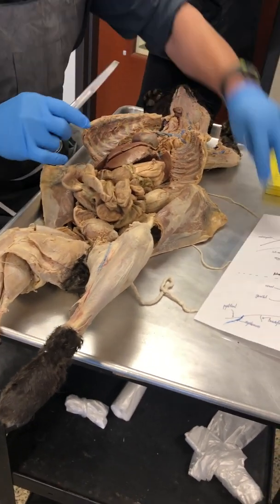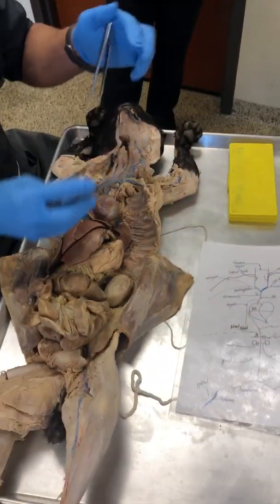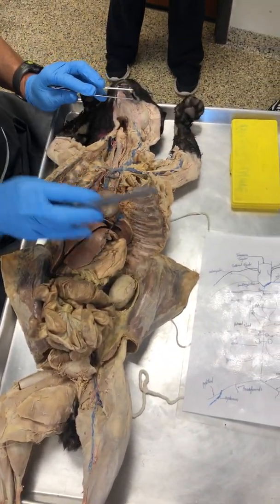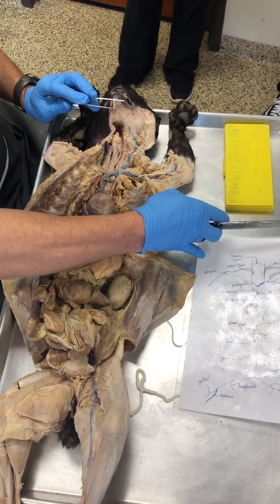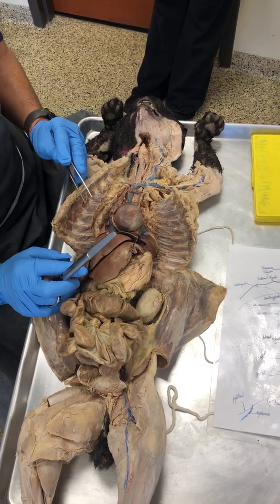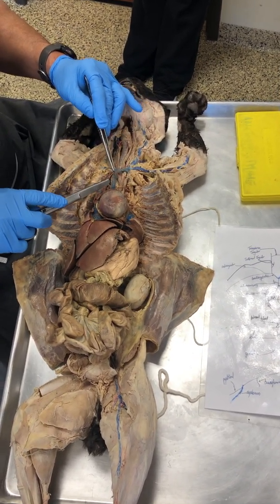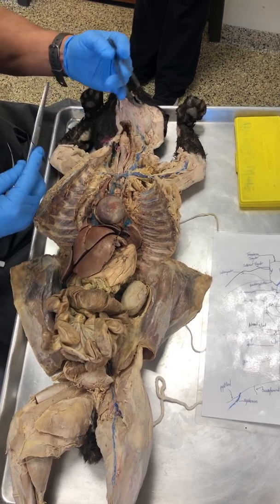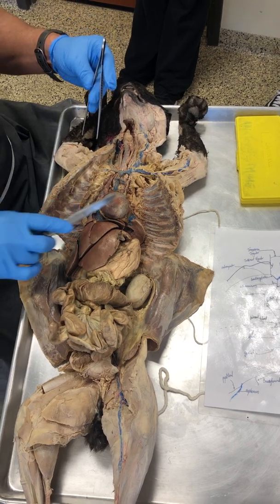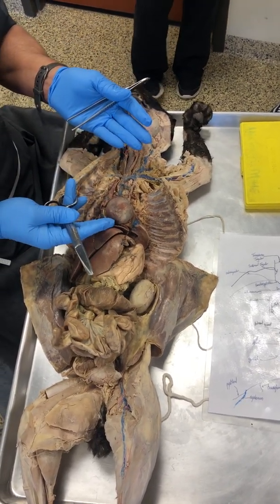All right, so let's see here. What we're going to do is look at these veins in two perspectives. The first one is the veins above the heart. All of these veins are going to drain into the right atrium. Now, the big thing that I keep talking about is establishing relationships, analogies, etc. A lot of what we're seeing here are blood vessels associated with one another.